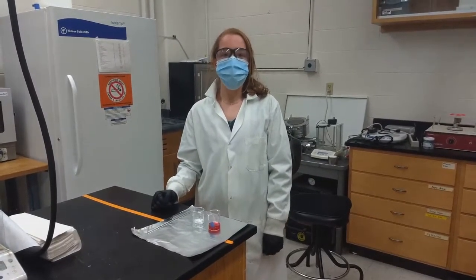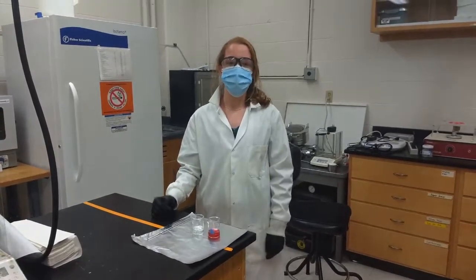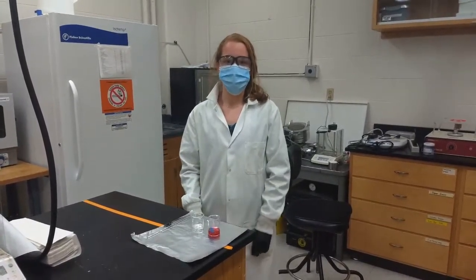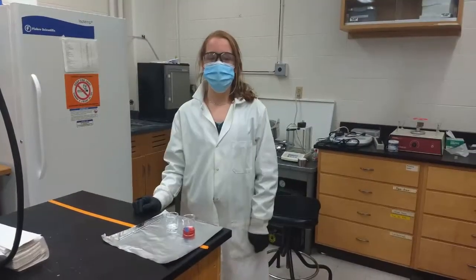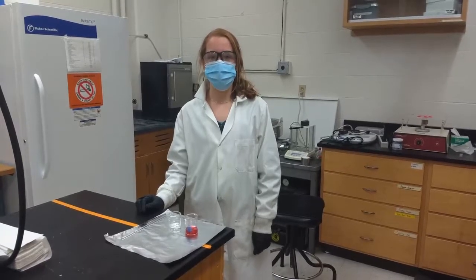Nylon is a polymer because it's made up of repeating units of the same smaller chemical units. We are going to make nylon through what's called a step growth interfacial polymerization.